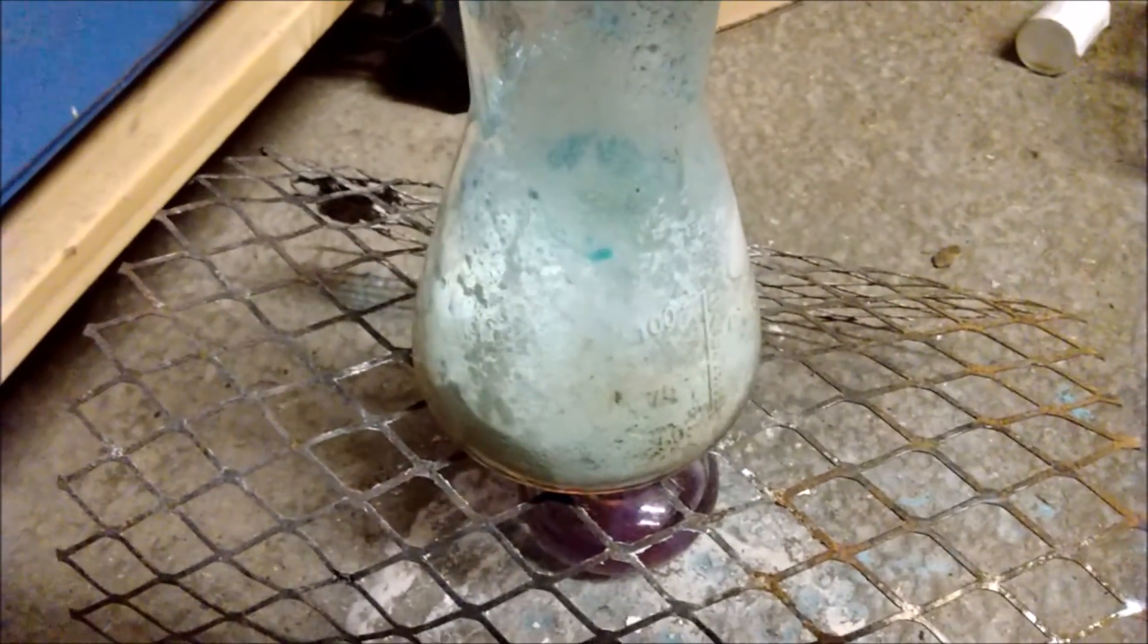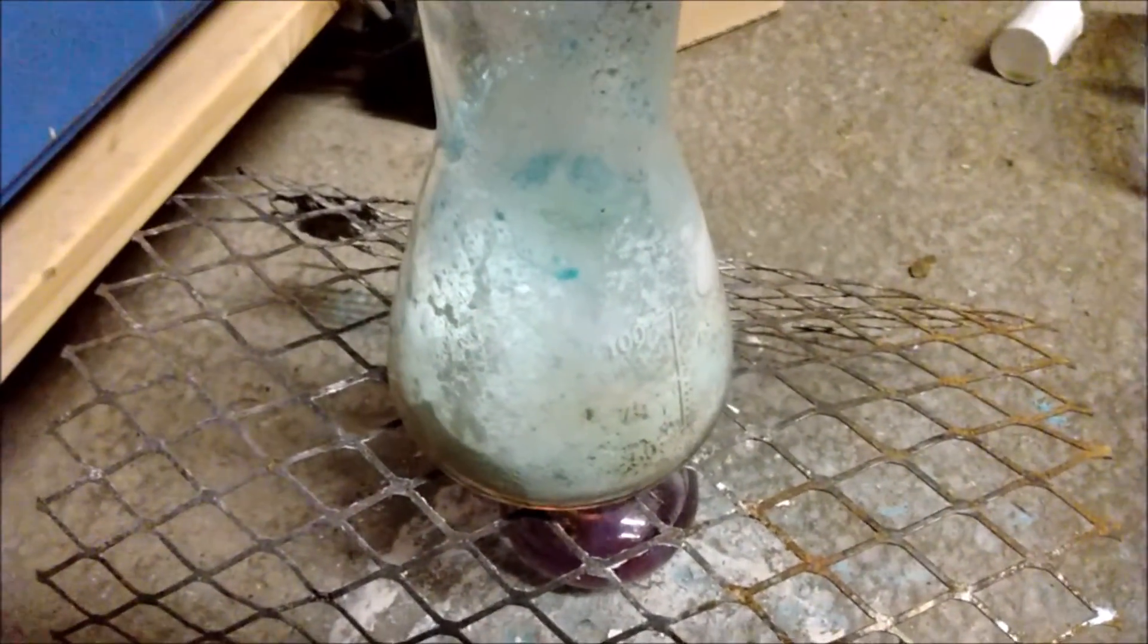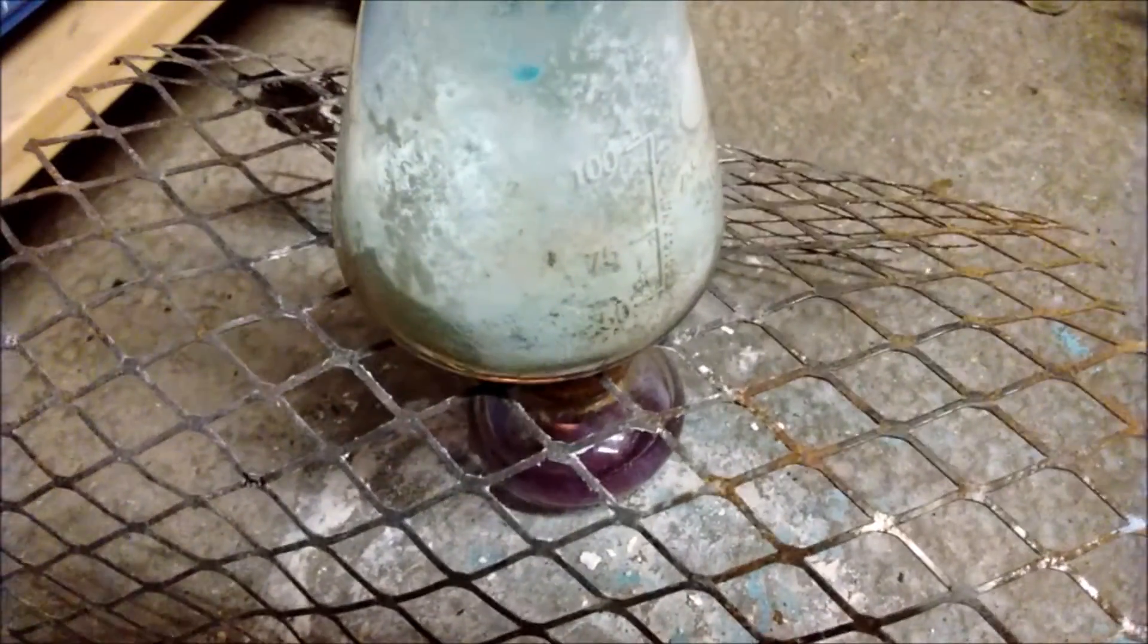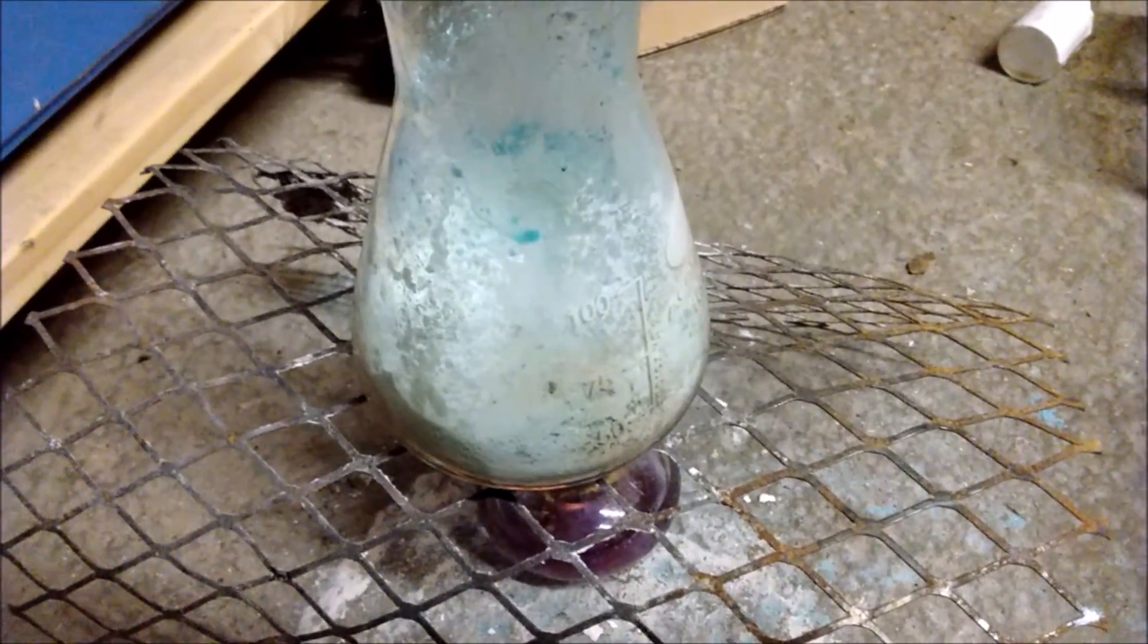So, now I've got to get it out of the flask, because the problem is, with the water, it all stuck together and it's stuck in a massive lump down at the bottom. So, I will cut back when I've worked out a way to do that.